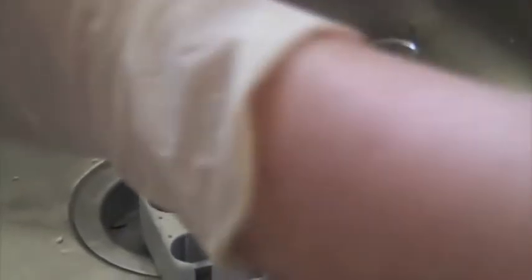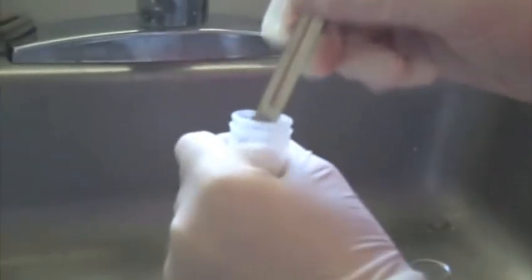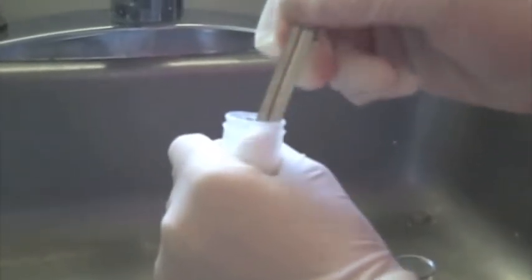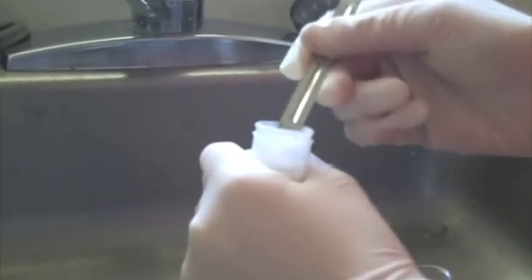Now I'm going to add some sodium carbonate to the water. There's my sodium carbonate. I'm going to add some sodium carbonate to the water right now and I'm going to dissolve it.